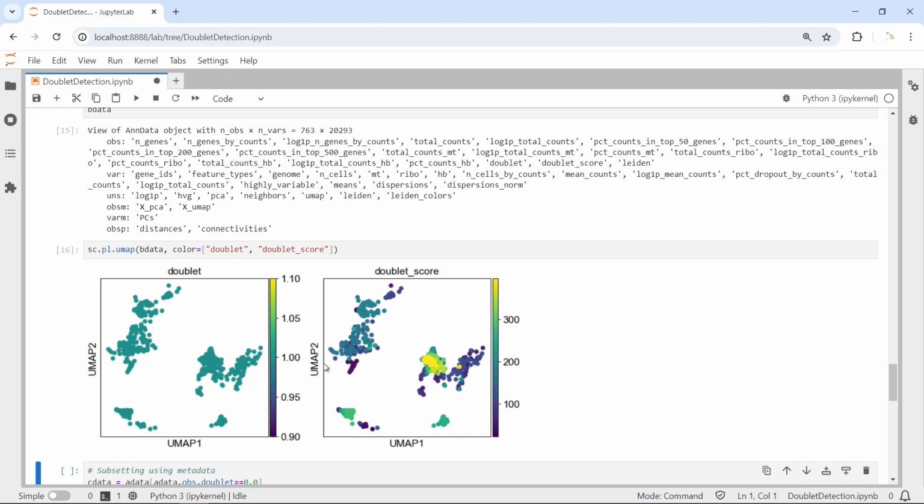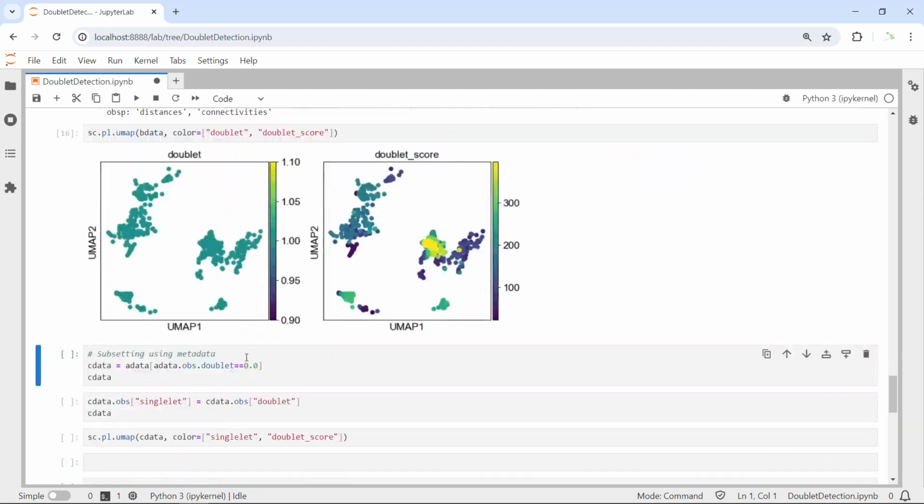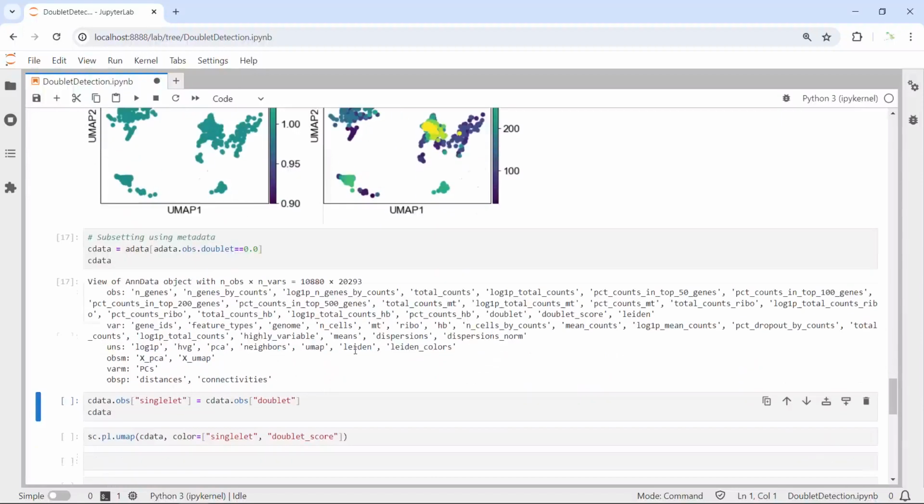Here I just want to show you we can see the doublets, but in reality we need to get rid of doublets. So next we can subset the data to keep all the singlets for downstream analysis. For the demonstration, I'm going to subset it as C data, but if you want, you can subset it as A data. So now we subset the data to keep all the singlets. Let's run. You can see we have 10,880 singlets in this data set.